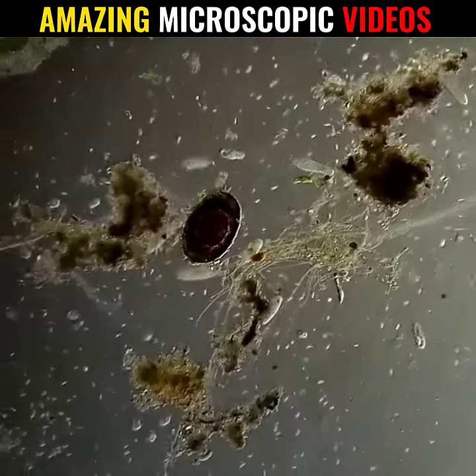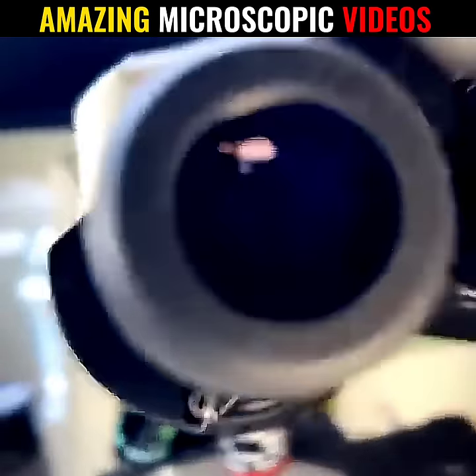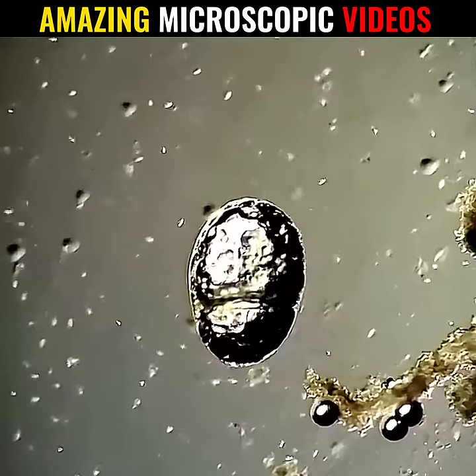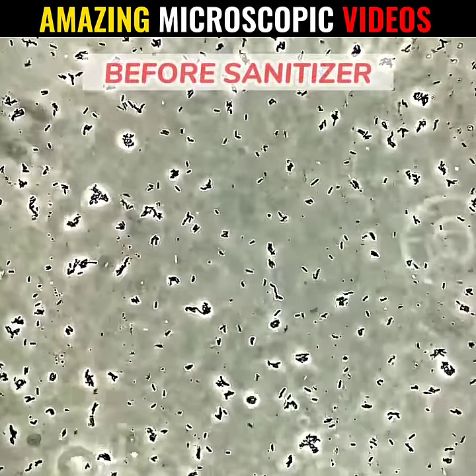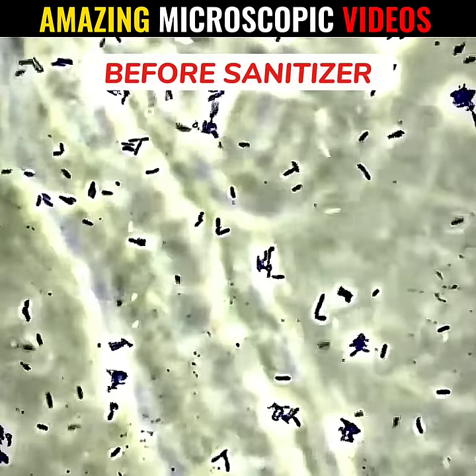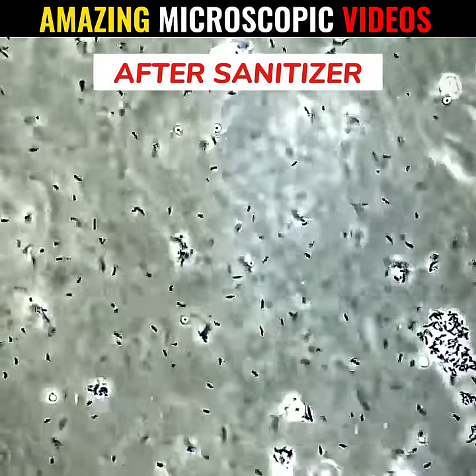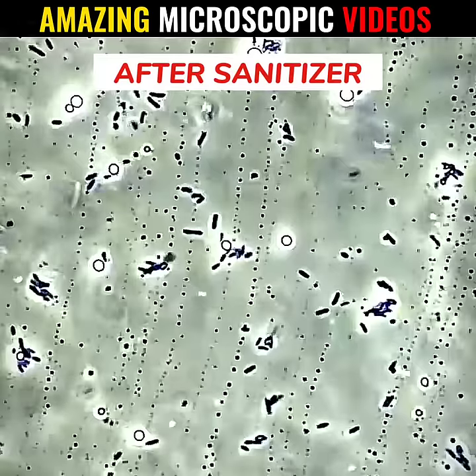Number 5: when sanitizer is applied on bacteria and then seen in the microscope, look here — before hitting the sanitizer, the bacteria are roaming here and there, having fun. But after applying the sanitizer, see how they all died.